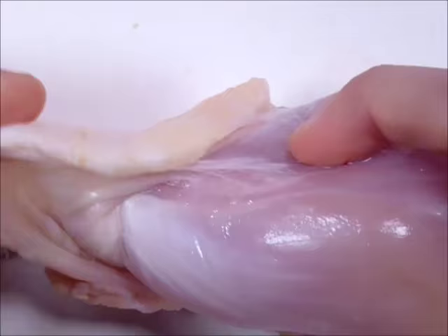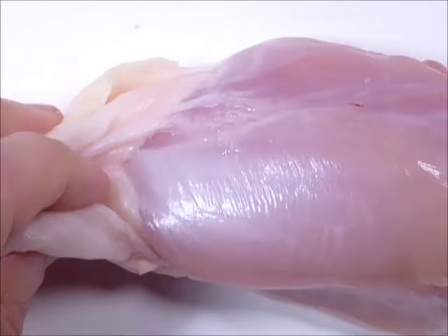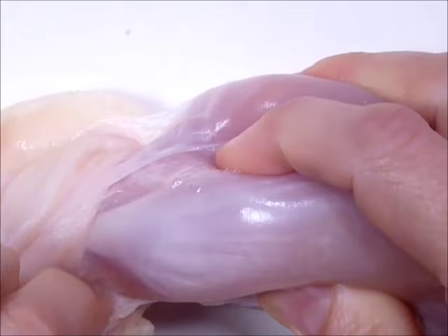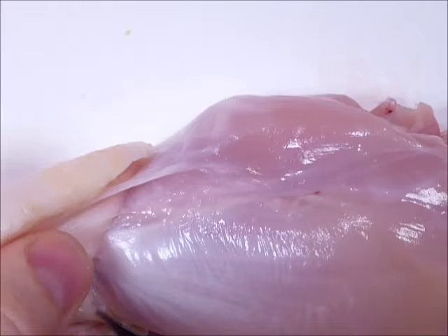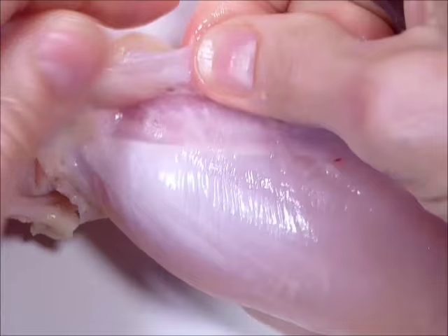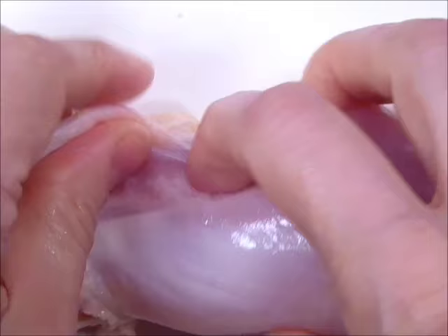I think we're coming up on another thing for our scavenger hunt. Be careful when you cut — not just not to cut yourself, but don't cut things you don't want to cut. Cut very carefully so we don't ruin parts we want to look at. This fascia is pretty thick here. Everything in the body is connected with fascia — we're basically just fascia with organs and bones stuck into little pockets in the fascia.